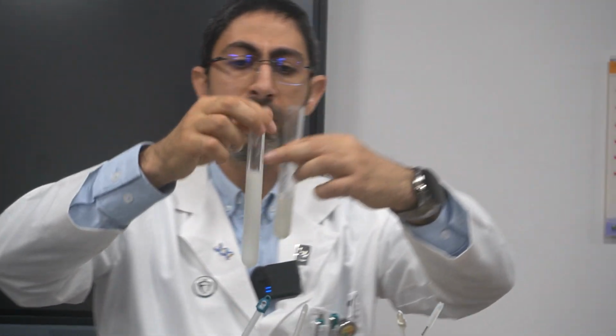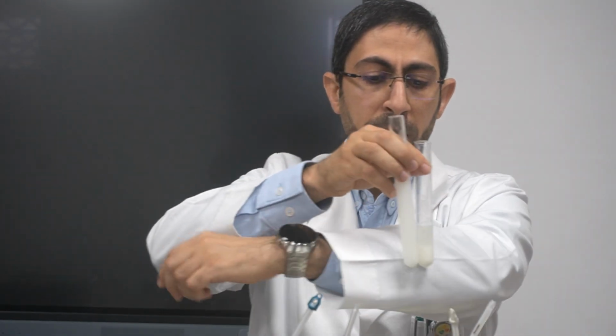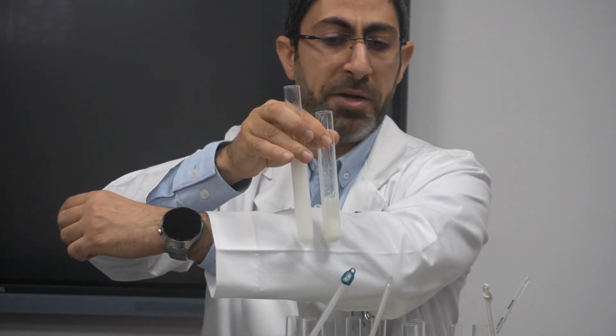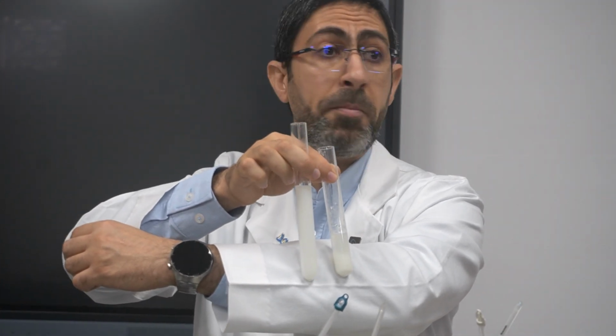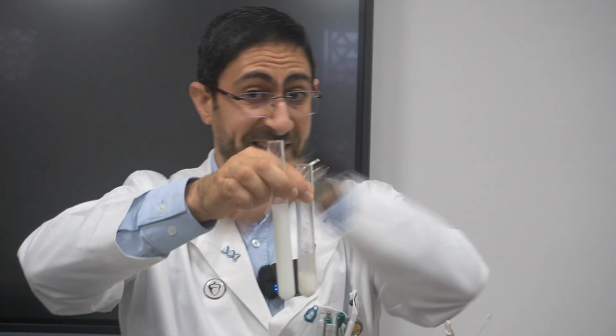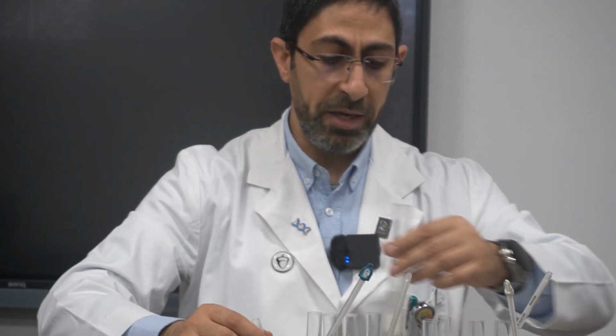You can see the X. If I hold both of them against my lab coat, you can see the big difference between the reaction that takes place at the optimal temperature, which is 40, and the reaction that takes place at a temperature above the optimal, which is in this case 80. 60, I'm sorry. It will be the same thing at temperature 80, because the enzyme will also be denatured. So here we investigated the effect of the temperature on the enzyme activity.